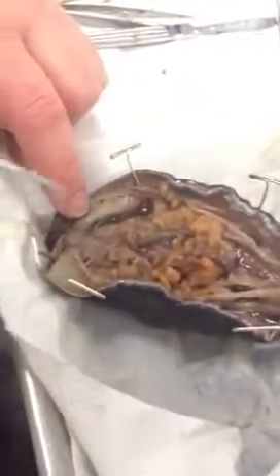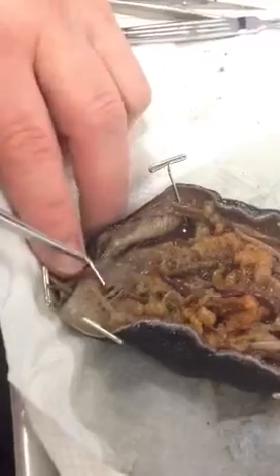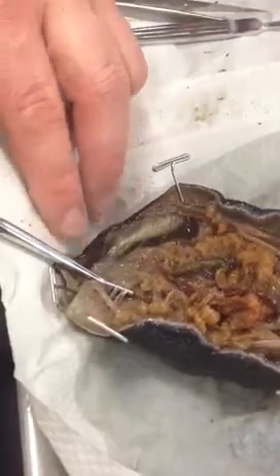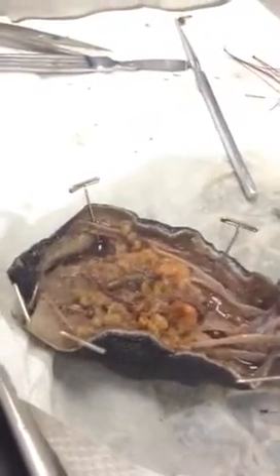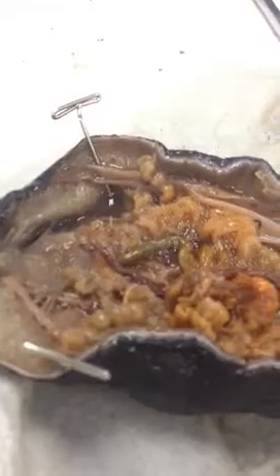At the anus, the end of the intestine is called the cloaca. And so right here you see this end is the cloaca. You see these tiny little string-like... Those are called the cloacal dilator muscles. And here you can see it too on the picture. The cloacal dilator muscles. So they can store a little bit of solid waste there at the end. And then those muscles are going to help to determine whether the waste stays in or is relieved from the body. Like these? Yeah, I just can't see them as well on that one.